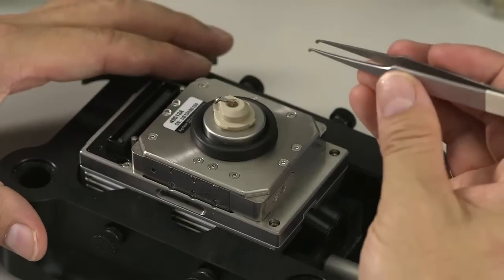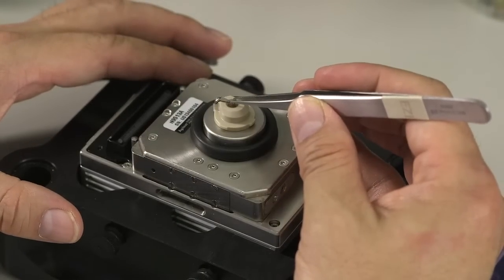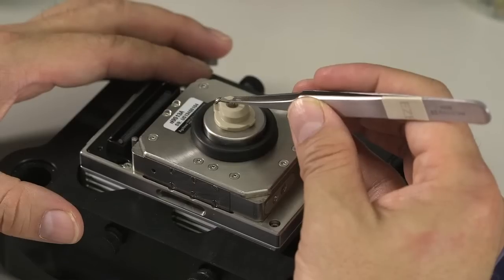Then, if you want to make sure, you could grab the cantilever with your tweezers and gently shake a little bit. It should be solid and not shakeable.